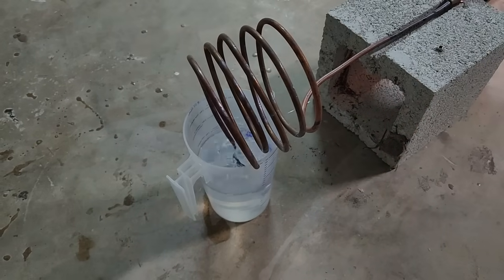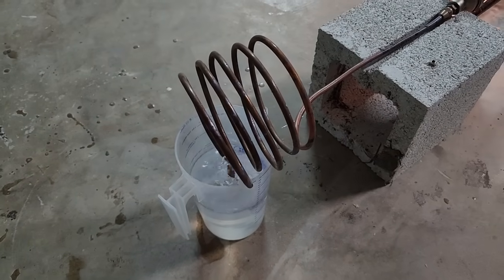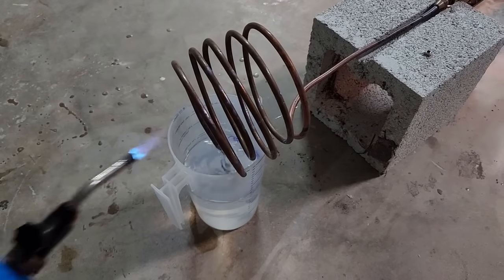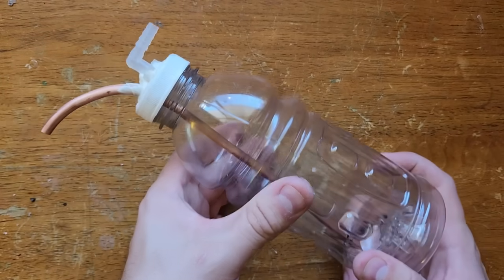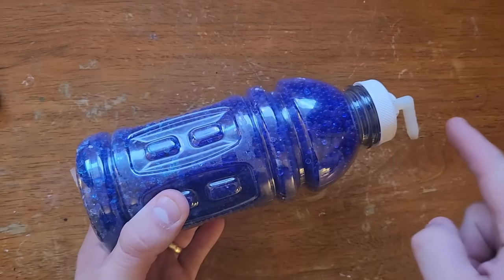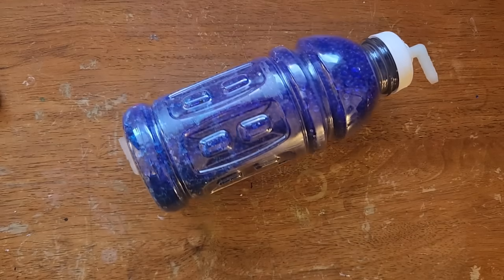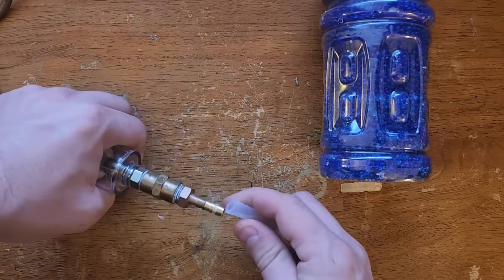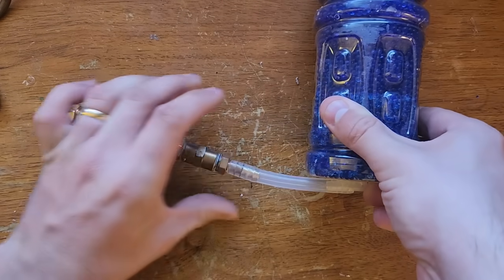So the general idea seems to work pretty well, but we need a few improvements to the generator. For starters, I need a clean, dry gas output that's not contaminated with water, unreacted ethanol, or particles. This bottle will serve as a bubbler to help filter any particles and catch any liquid that comes over from the condenser. This one is the dryer — the blue beads inside are silica gel desiccant, which will turn pink when they're saturated with water. This stuff is awesome at removing moisture, but can generate some dust particles, so I'm installing this filter in line with the dryer. I think this one only filters down to about 50 microns, but that should be fine for my application. The dryer and the filter are placed in a 3D printed bracket and joined with a silicone tube.